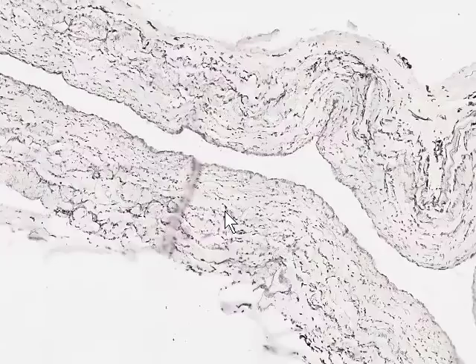So you can look and take some pictures and make comparisons for yourself between the muscular vein and the accompanying muscular artery with respect to both the arrangement as seen in H&E and also the presence and arrangement of elastic fibers as seen with special elastic stain.